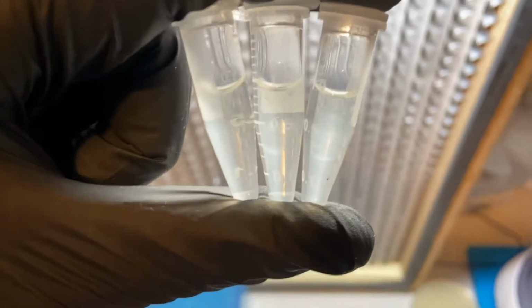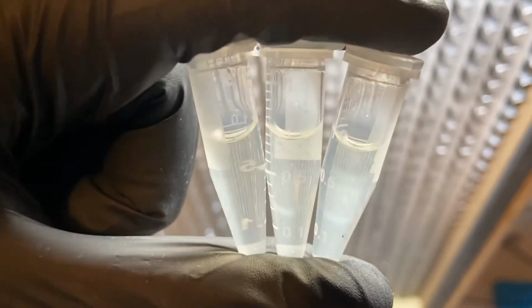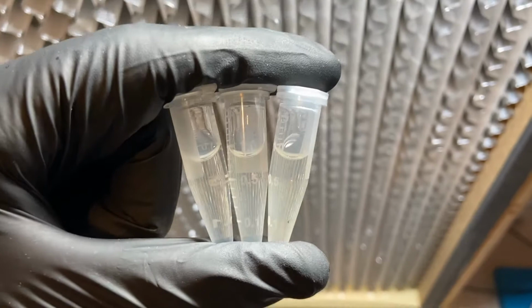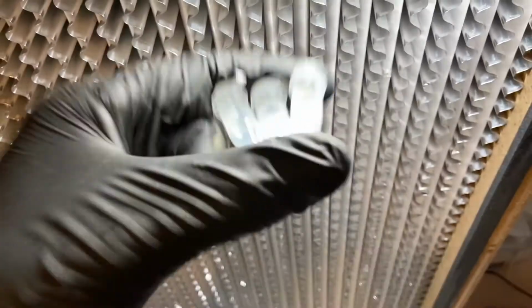The 3 samples are prepared with kanamycin, 1.5 microliters per tube, which is a little bit more than the 1 microliter per milliliter that we need, but that's okay. And they've been inoculated with a single colony from each of the plates where we're growing the colonies. So you can see how clear the broth is now. We're going to go ahead and put this in the incubator for a couple of hours.